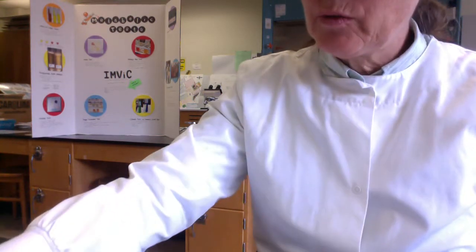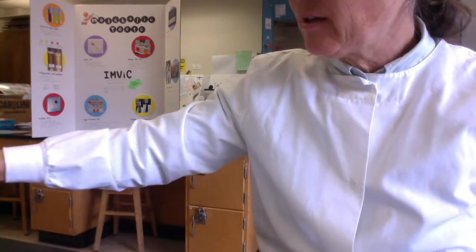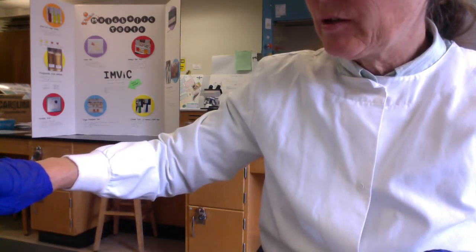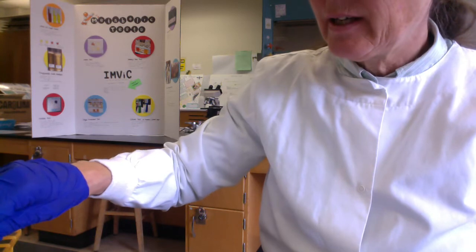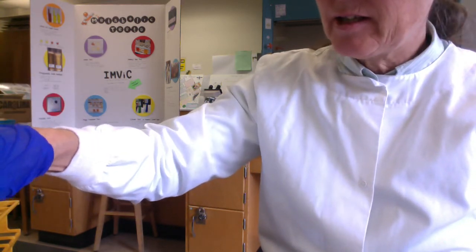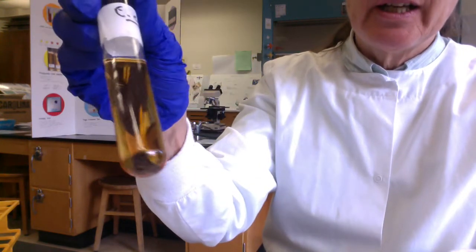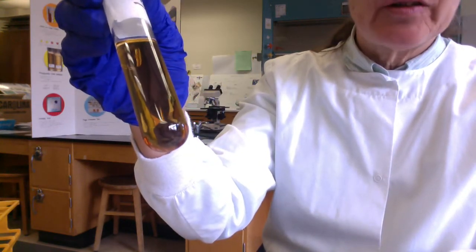Hi micro folks, we're just doing results of our chapter 11, aseptic transfer of bacteria. So folks, you'll recall that we transferred bacteria into sterile broth. So here's some of our sterile broth, and notice it's transparent, and that indicates that no cells are present.